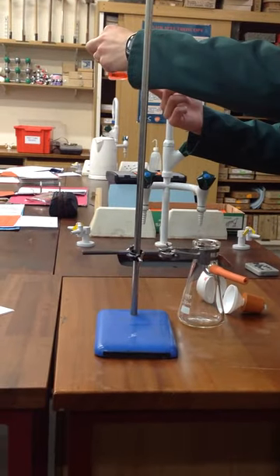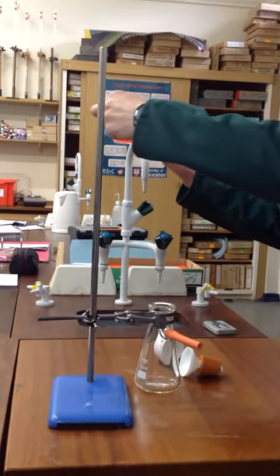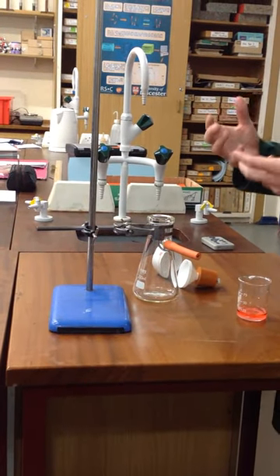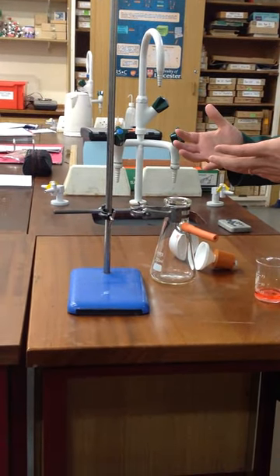Solid in there and a load of liquid impurities, basically you want to get rid of it. Now you could just set up a filter paper as normal and then just filter it, but it's going to take a long time, so this is basically a way of doing it quickly.